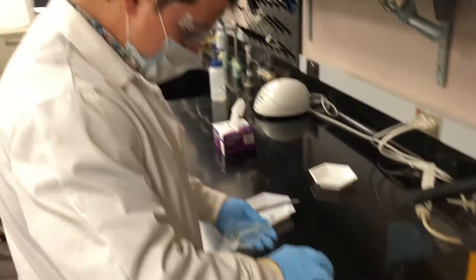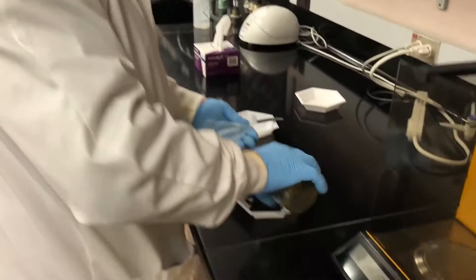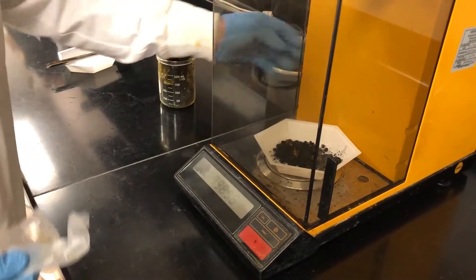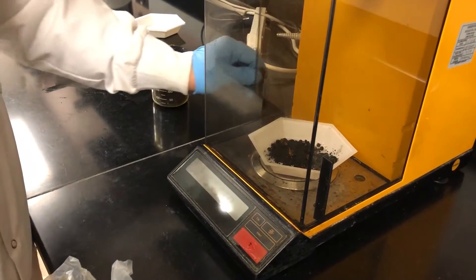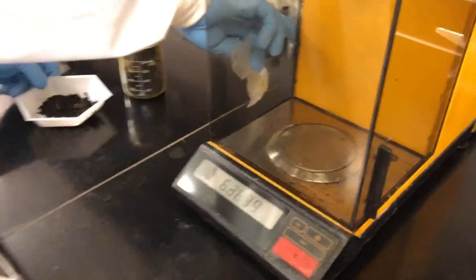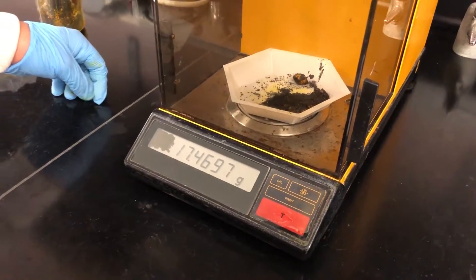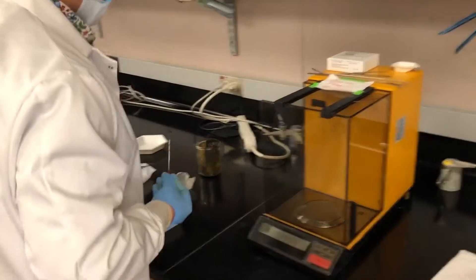Have you gotten good at figuring out, just estimating it? I think I figured out a little pattern. What's the mass that you're shooting for? 17.5 grams for the ferric chloride. It's reading 19.5 in this case — we're going to assume he gets that sorted out. And there we go, 17.5. I'd call that 17.5 — close enough for barrel work, for sure.